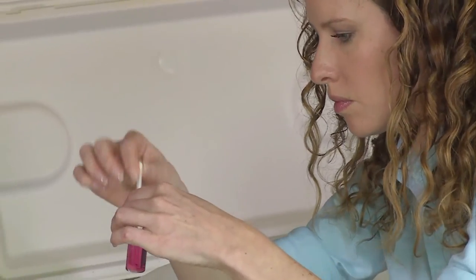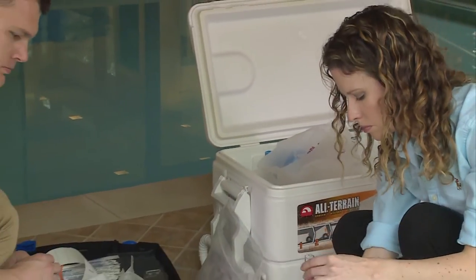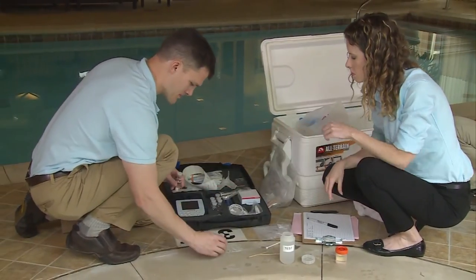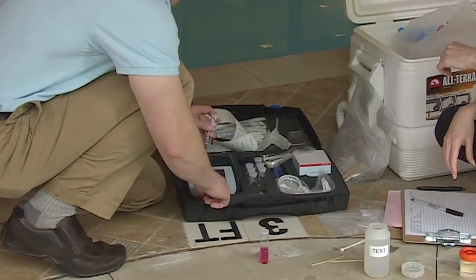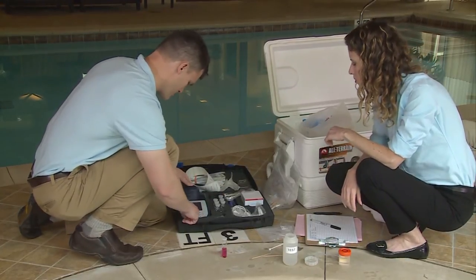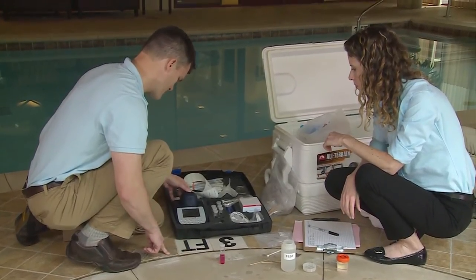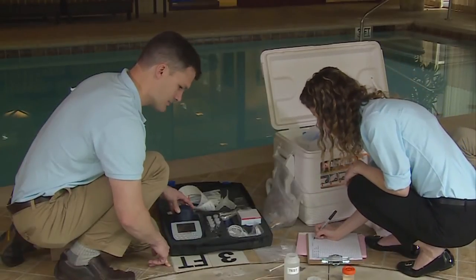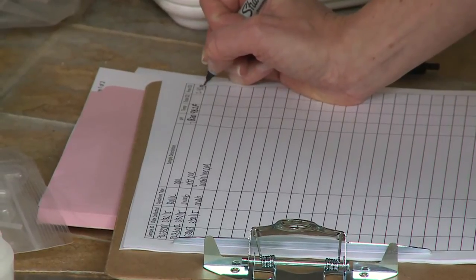It is best to use a pool test kit or digital color-o-meter to measure residual disinfectant in spas. Spas may use other halogenic disinfectants such as bromine; follow the test kit instructions for conversion. If the residual disinfectant levels exceed the maximum limit of the test kit, perform serial dilutions to bring the sample within the test kit's range. If there is a very small amount of disinfectant in the spa, use your potable water test kit. Record all data on the sample data sheet.